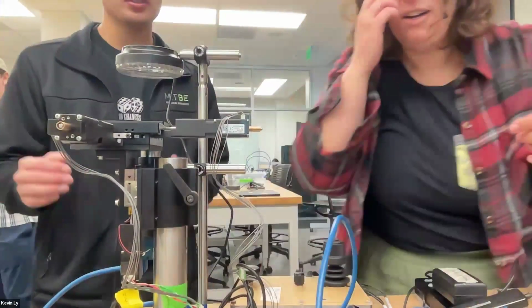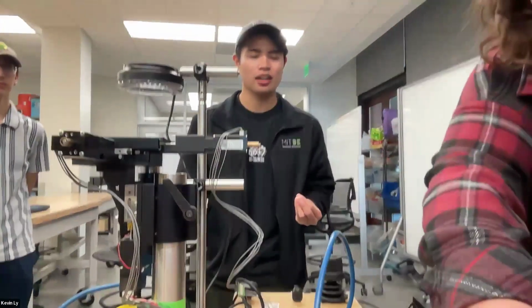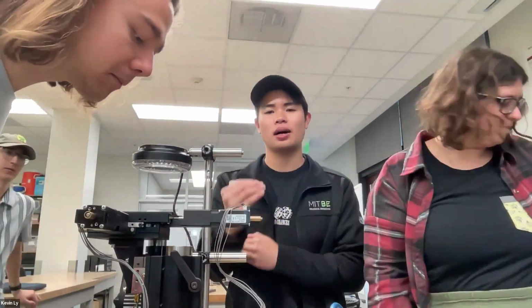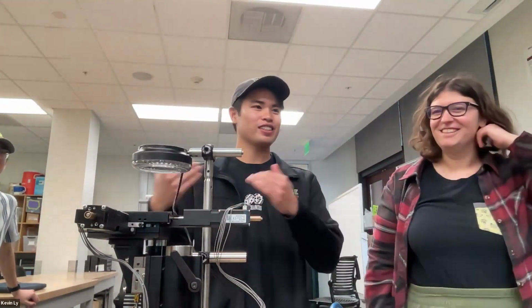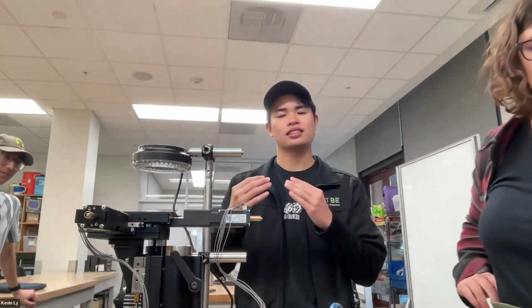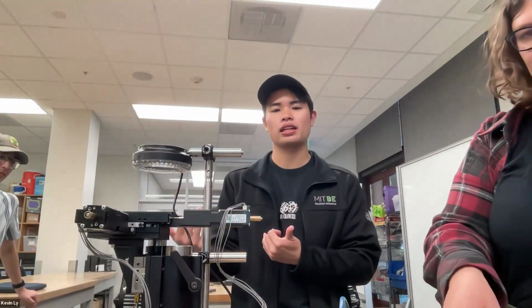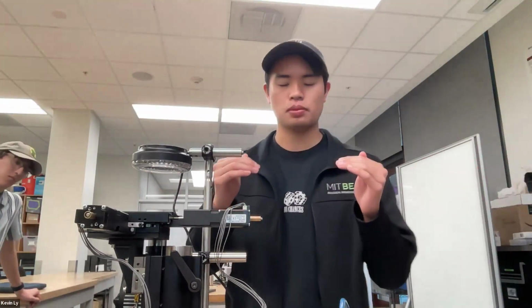So an objective. In order to see something and magnify it, basically, the objective is called an objective because it's the lens that's closest to the object of interest. The other lens is called the tube lens because it's in the tube. There are many considerations about lenses. One number that differentiates them is their focal length. A focal length defines one important aspect of a lens.